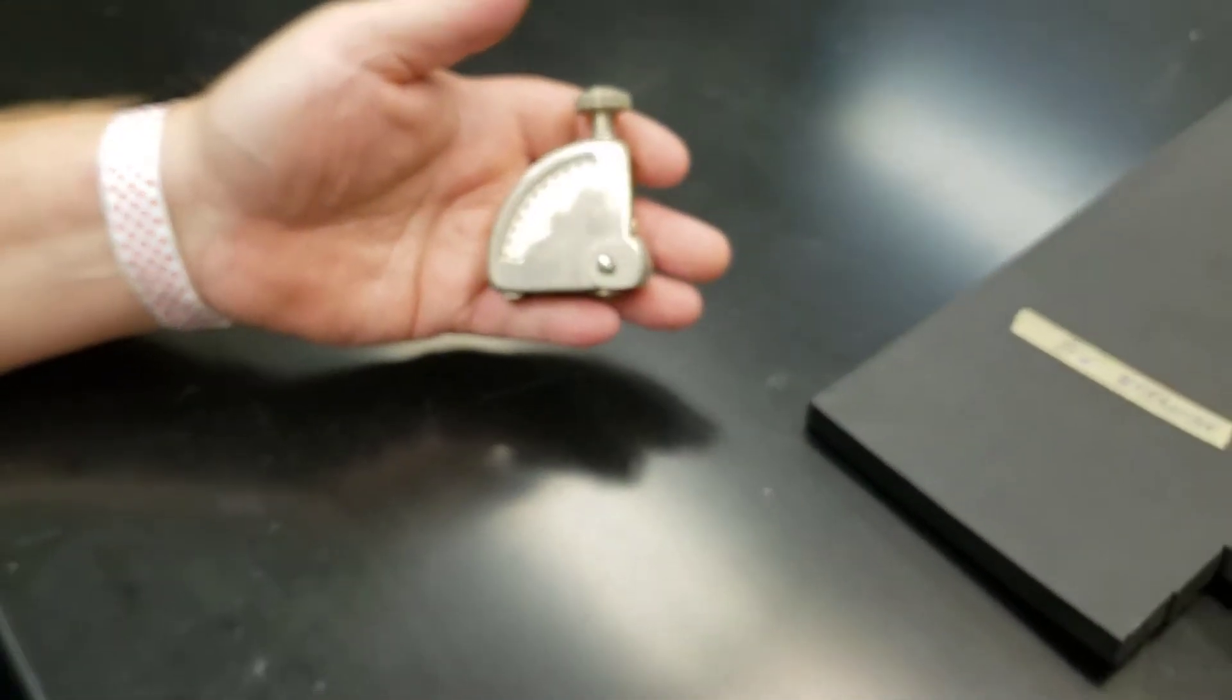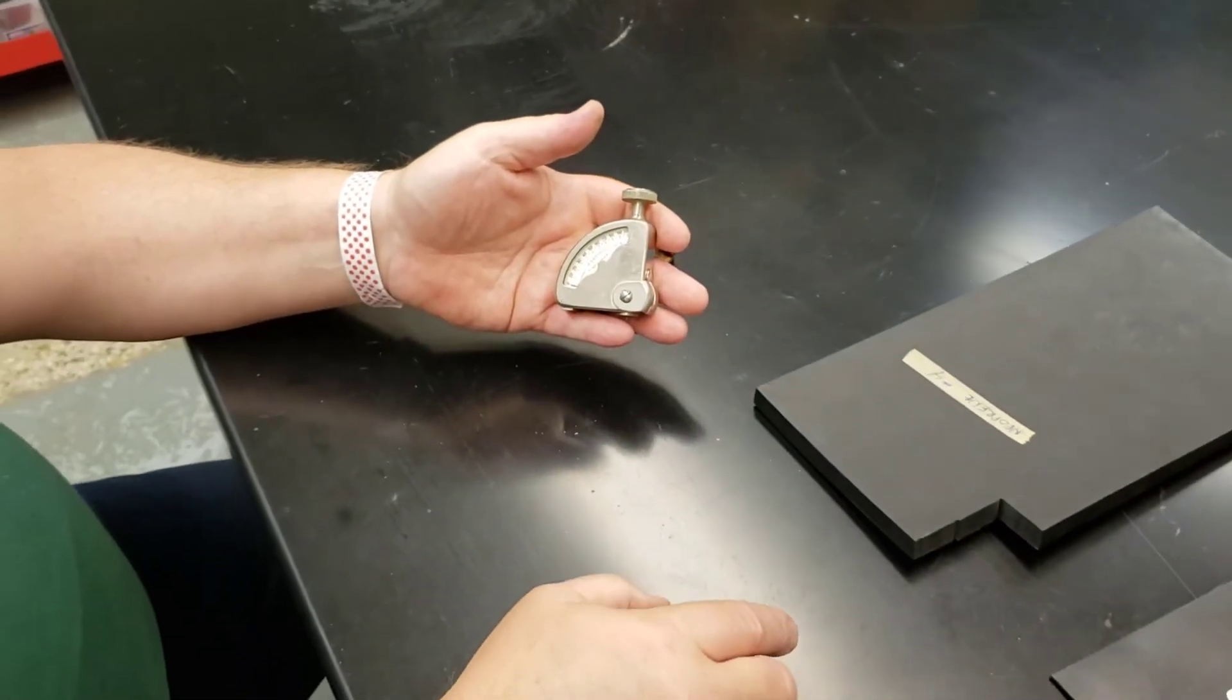Let me show you how it works. It comes in a nice carrying case because the idea is you can take this with you.